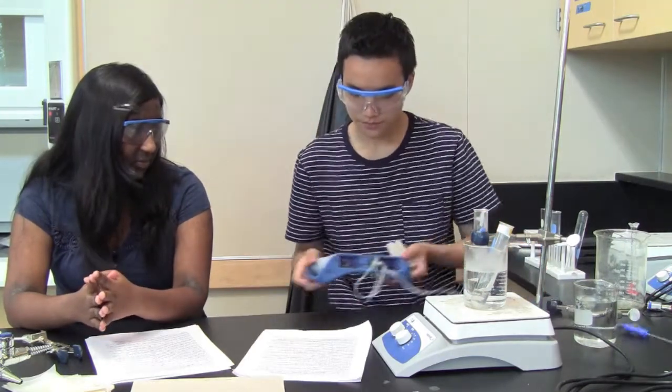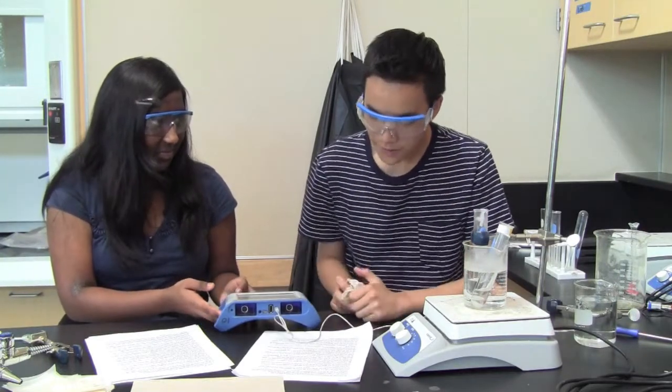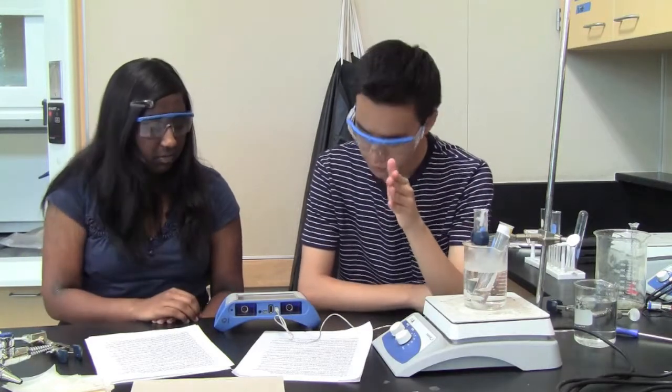The freezing temperature can be determined by finding the mean temperature in the portion of the graph with nearly constant temperature. Now, select the data in the flat region of the graph. Find the mean temperature of the selected data, record this value. Store the data so it can be accessed later, and you never can be too careful.